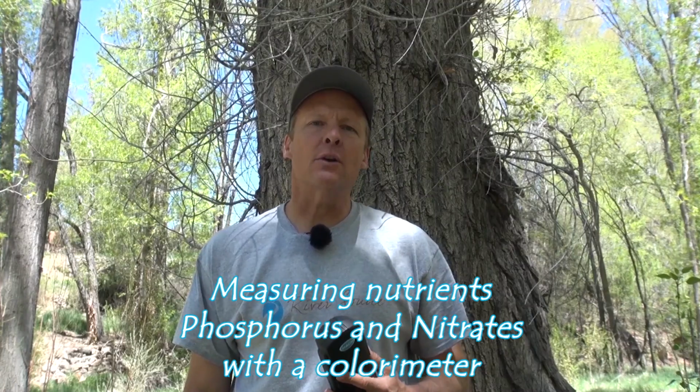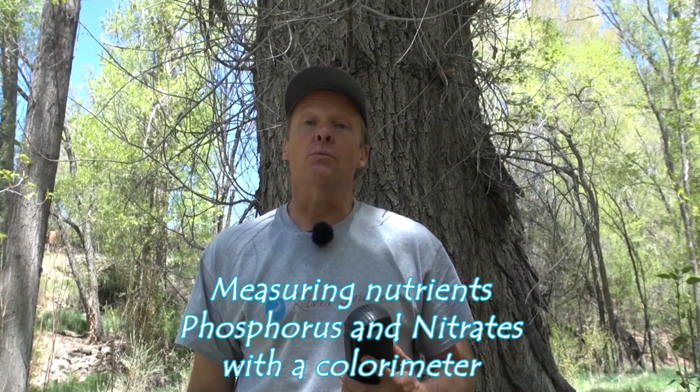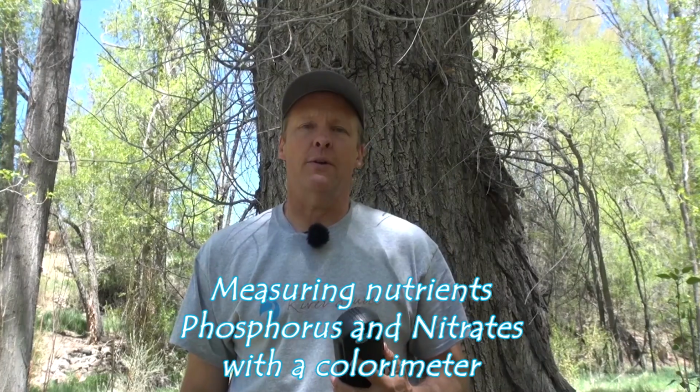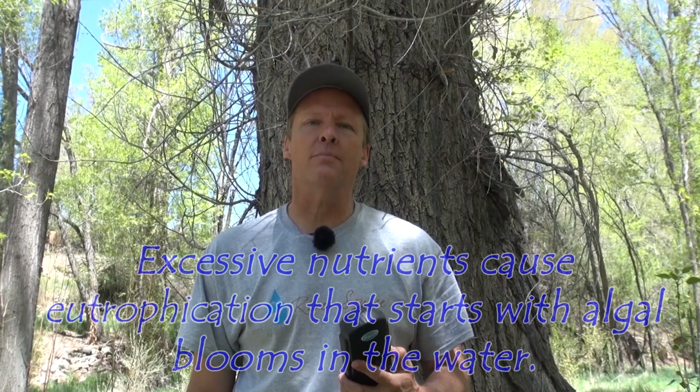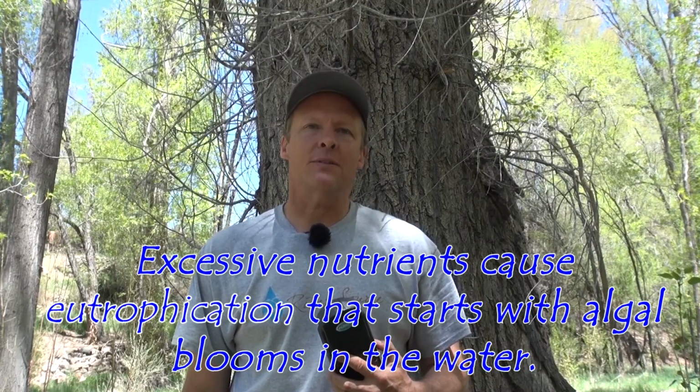So now we're going to measure the nutrients in the stream, and that can really impact how much algae starts to bloom in the stream, and then also how much oxygen's in the water. If you get a lot of algae because of excessive nutrients, then you can have a big crash in oxygen when that algae starts to die.